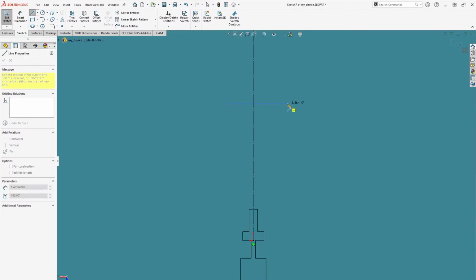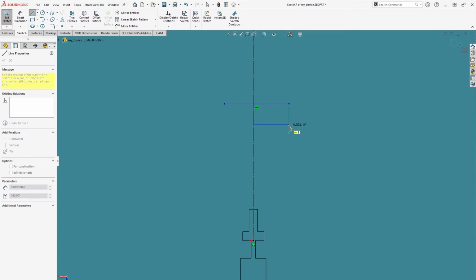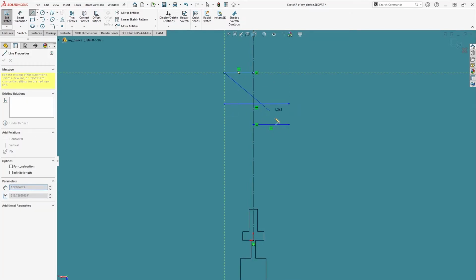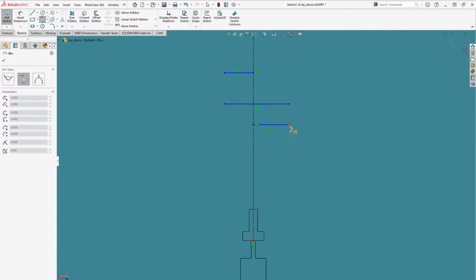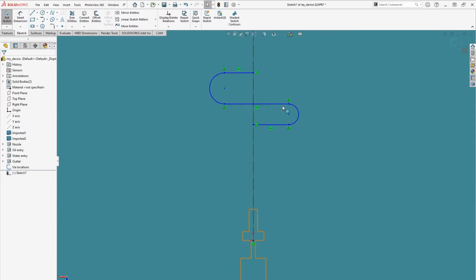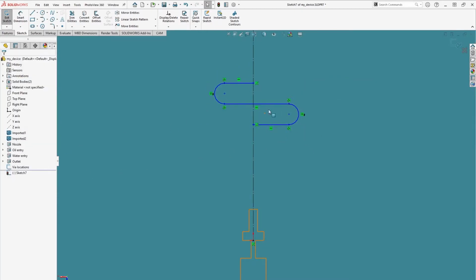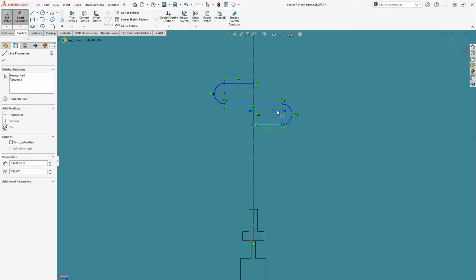To do that, we sketch a few horizontal lines. Then we'll connect them with tangent arcs, making sure to create a tangent relation between each arc and its corresponding line. We'll select each arc, add an equal relation, and then a symmetric relation between the endpoints of the horizontal line and the center line. We'll add dimensions to make the spacing between the channels and between the center points of the arc.